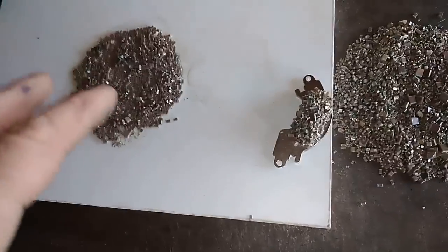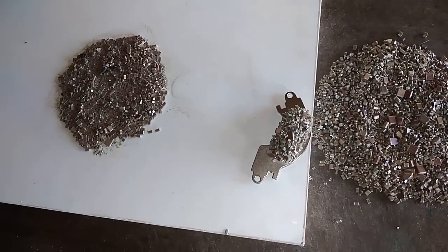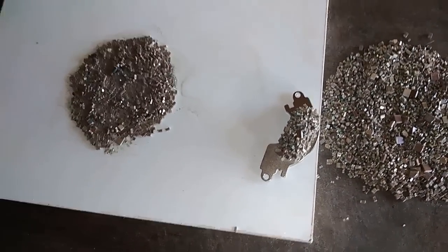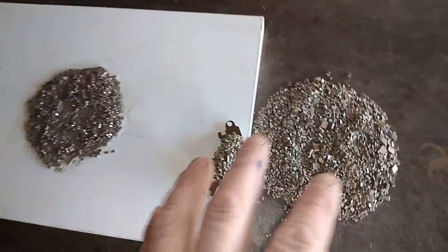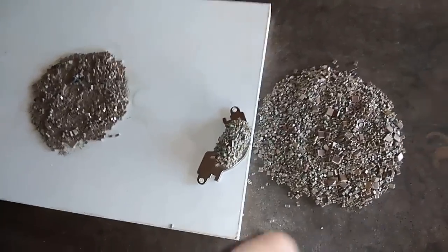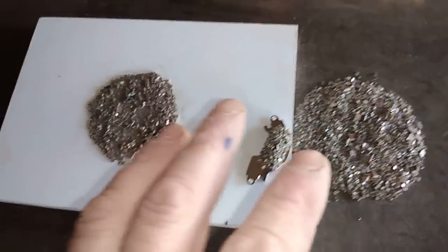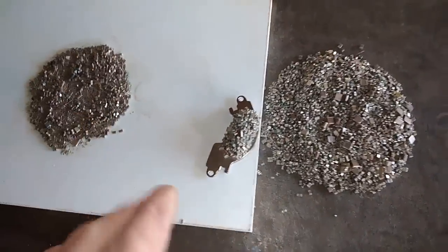I don't know why people separate magnetic from non-magnetic, but in the acid, when you leave everything to dissolve, it's not a problem. But if you maybe left some metal behind, then the magnetic material makes a problem with the non-magnetic, because magnetic metal always cements metal very fast from solution. So the best way is, at the beginning, you just separate magnetic from non-magnetic and do them separately.